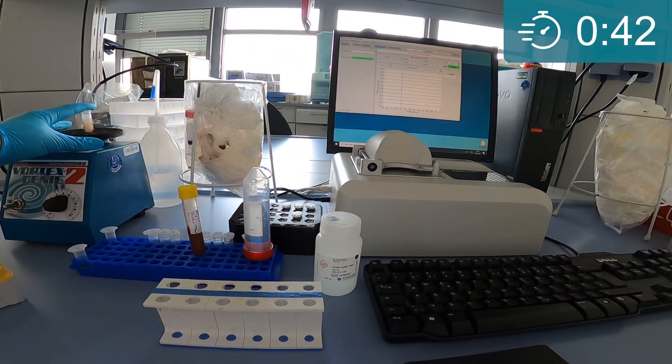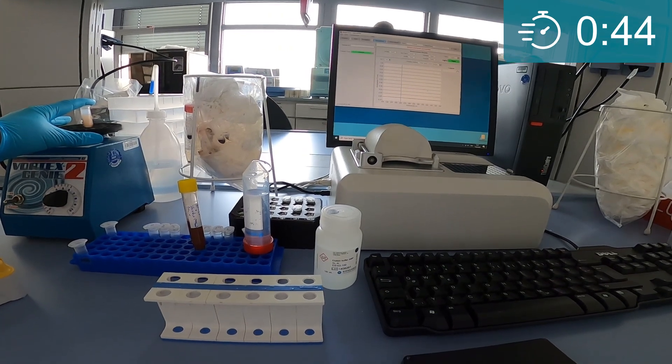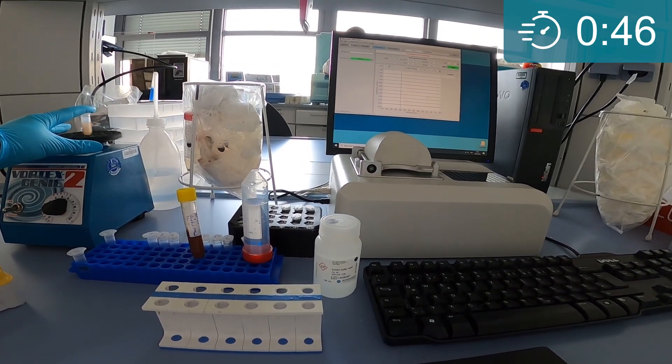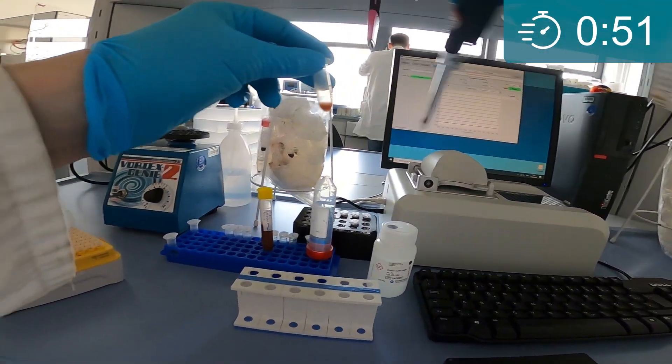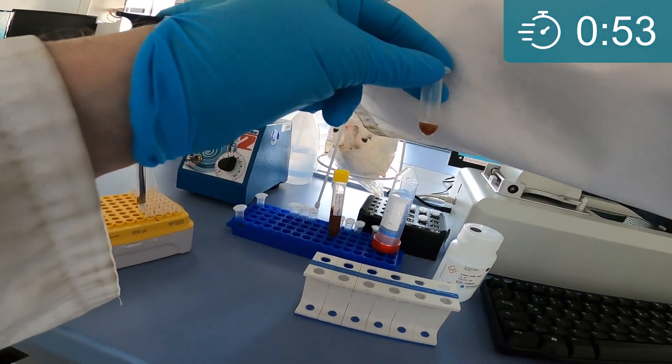After just 30 seconds, the binding reaction is finished. We have introduced wash properties into the binding buffer, so the binding reaction is a simultaneous binding and washing step.